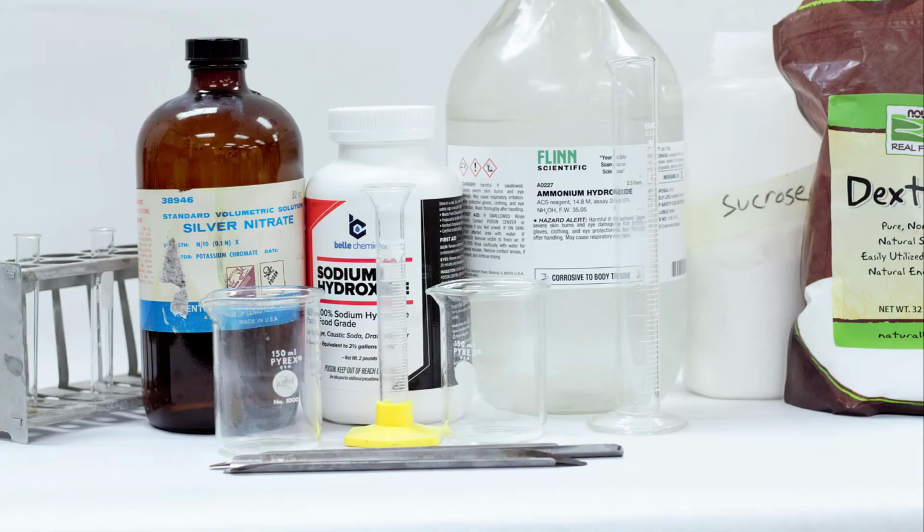For producing Tollens' reagent, you'll need some other materials. You'll need 2 more test tubes, but you can use the same rack. You'll need silver nitrate, you'll need sodium hydroxide, and ammonium hydroxide, which is concentrated ammonia. You'll need to get this from the fume hood, because, as you may have smelled before, ammonia can hurt your nostrils if you breathe it in too deeply. You'll also need a 150 milliliter beaker, a 10 milliliter graduated cylinder, and a 50 milliliter graduated cylinder.